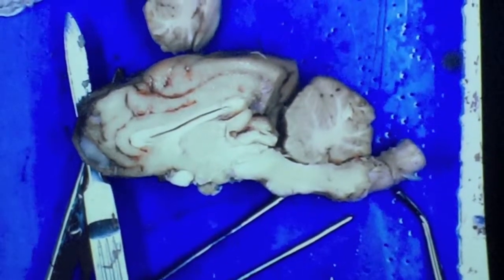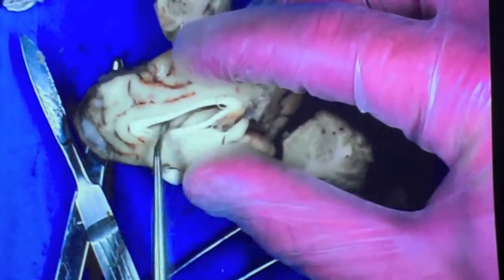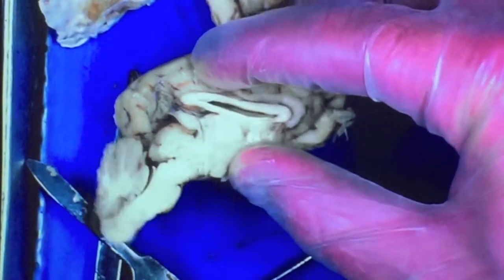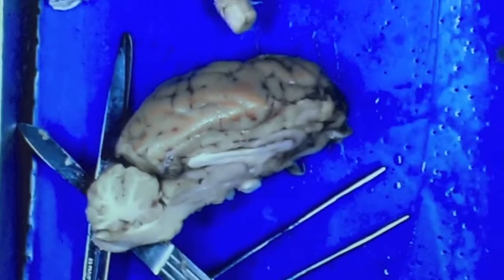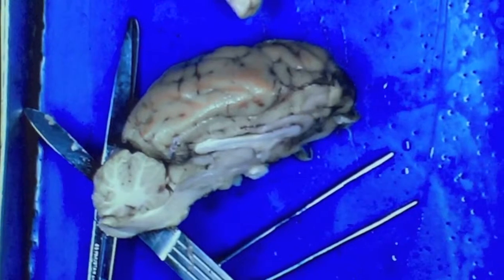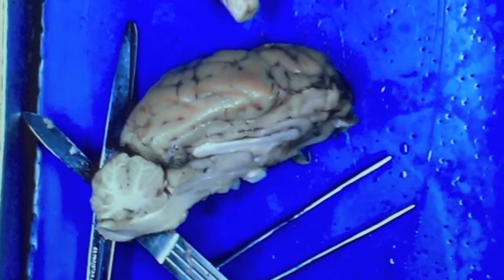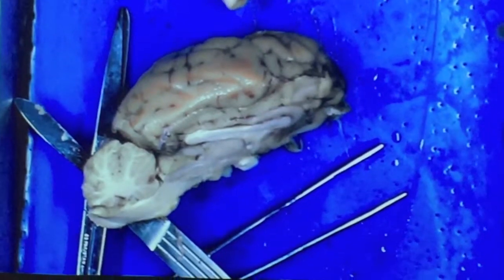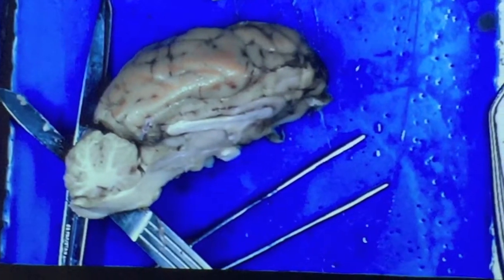Next item on the list, underneath the corpus callosum, and there may be a membrane here that you kind of have to pull apart. Let's see if the other one's like that. Yeah, so here you can see as I pull it apart, underneath my corpus callosum, there's kind of a membrane here, but if you pop that a little bit, you'll see there's a large cavity. That's the lateral ventricle. There's one on both sides, so there's two lateral ventricles. As I mentioned earlier, the brain has hollow spaces where cerebrospinal fluid circulates. The ventricles are one of those areas. So there's a ventricle underneath each of your cerebral hemispheres.